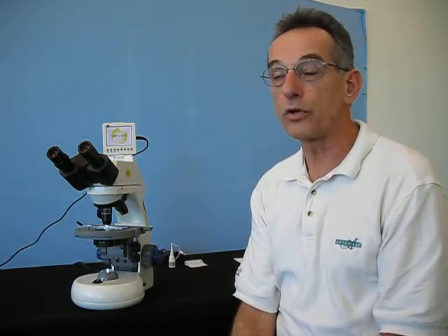That is a very quick overview of your instrument. If you will take care of it, keep it clean, adjust it for your particular eyes and your particular use, it will give you very excellent clear images of your subject matter. I hope that you enjoy it and take good care of it.